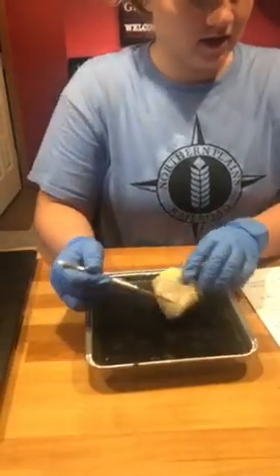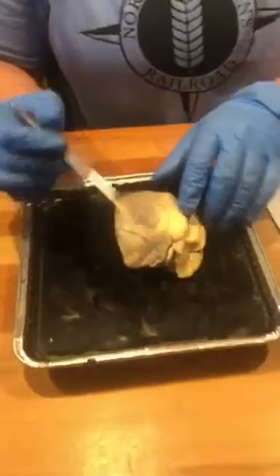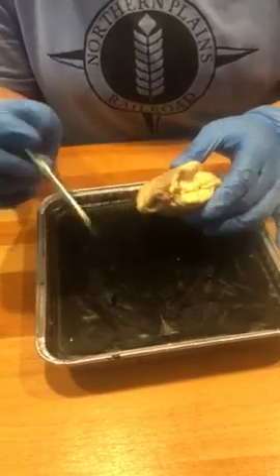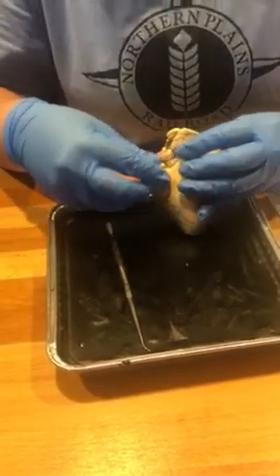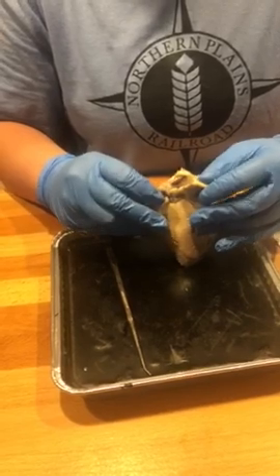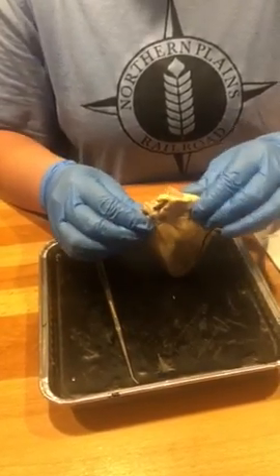The apex of the heart, the inferior point of the heart. And then this is the base, the superior part of the heart, where blood vessels enter and exit. Then we have the auricles, which are the ears, right here and here. Ear-like flaps that stick out on the anterior view above the right and left atriums.